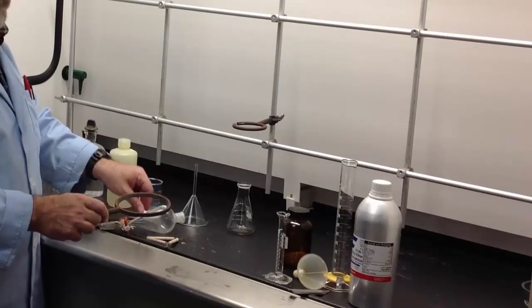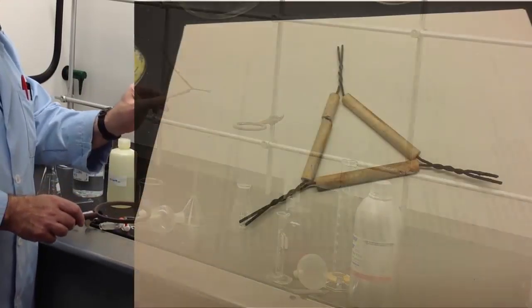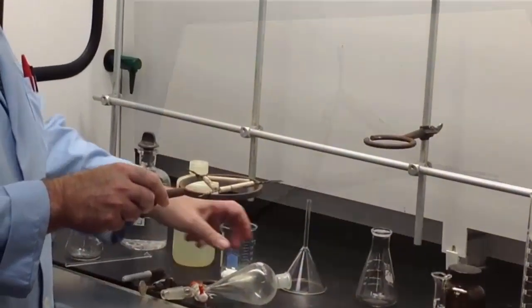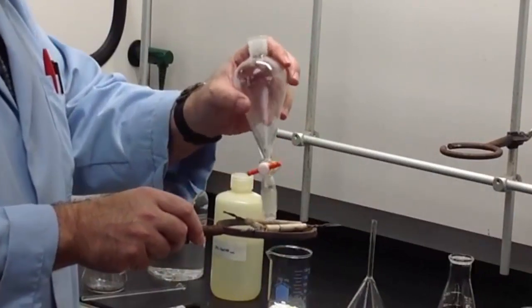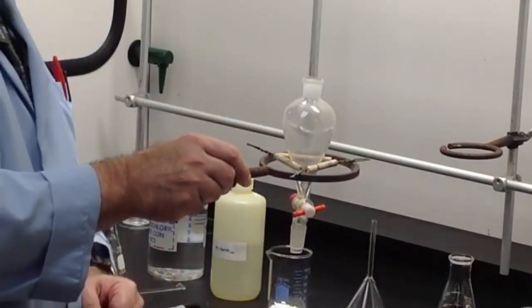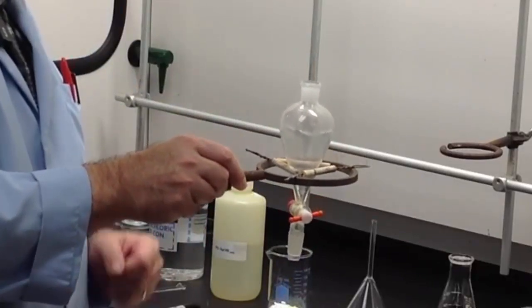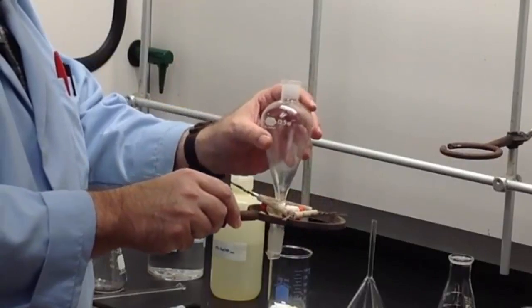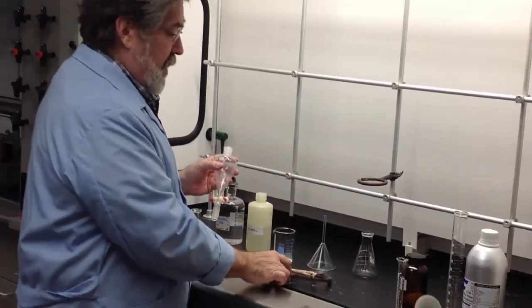An easy solution to that, if you have it, is a clay triangle. The clay triangle can be placed right on top of the larger ring clamp, and then the separatory funnel placed inside the clay triangle. Now that allows for resting the separatory funnel inside of a larger ring clamp.